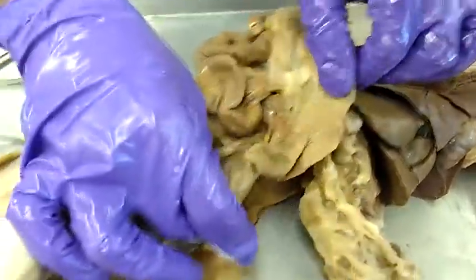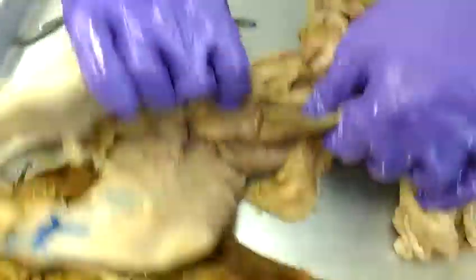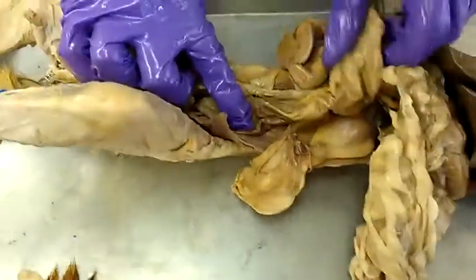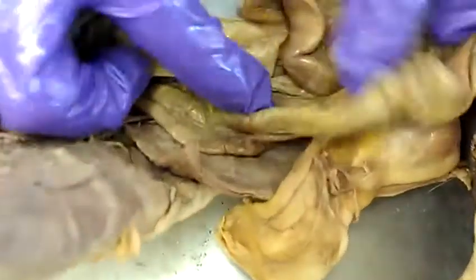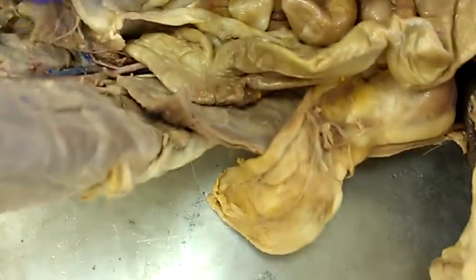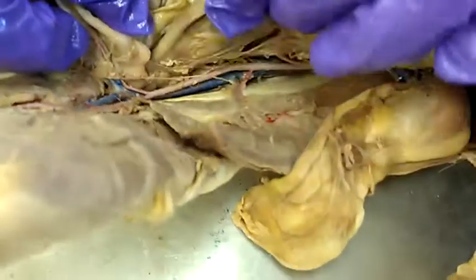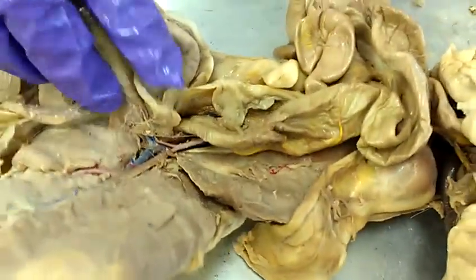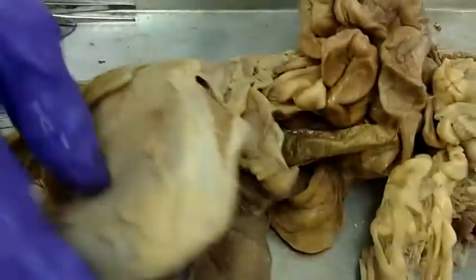And this is the large intestine, but on this one it's so small. There's the large intestine — cecum — and that goes into the anal canal.